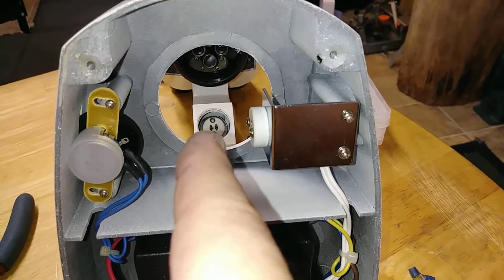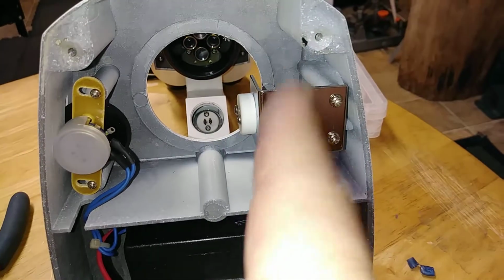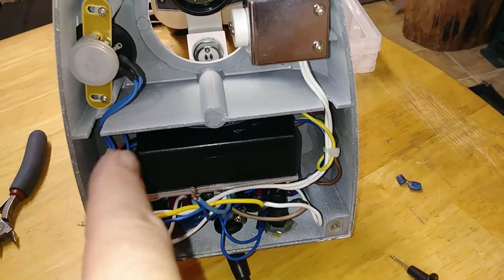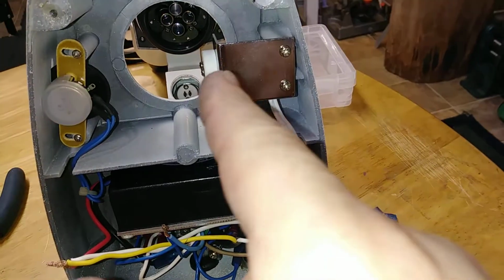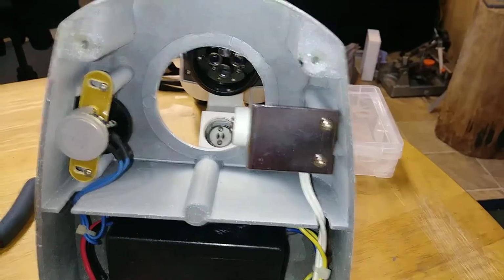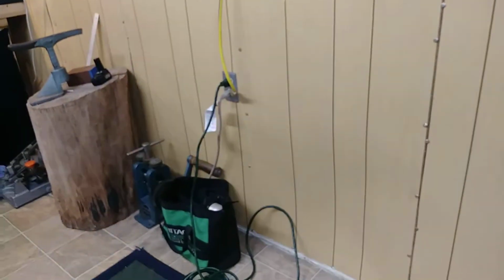Well, that's the focus beam, but this is the spot. So spot and field. There you go, field and spot. So this is the field controller. This control wire goes in and regulates a voltage over onto the actual field piece. But what we're trying to figure out is why the spot doesn't work, yet the field does, and it works with the regulator.